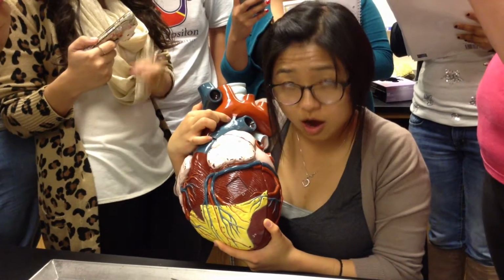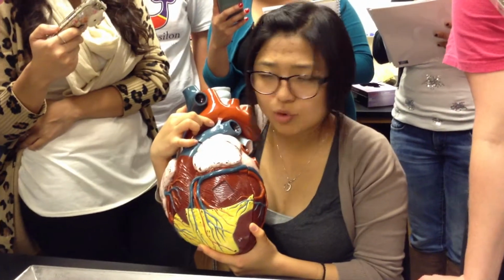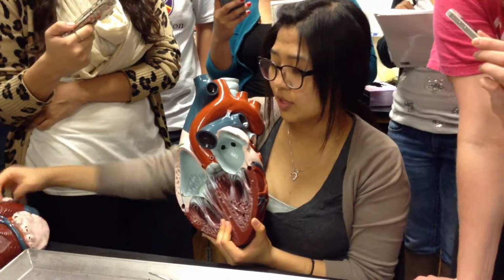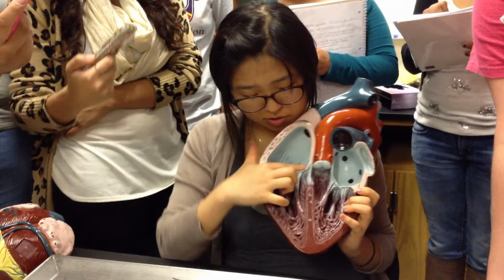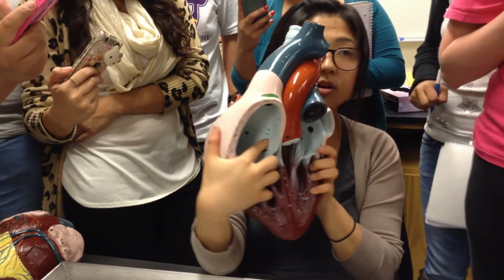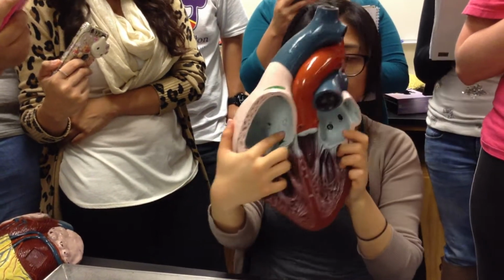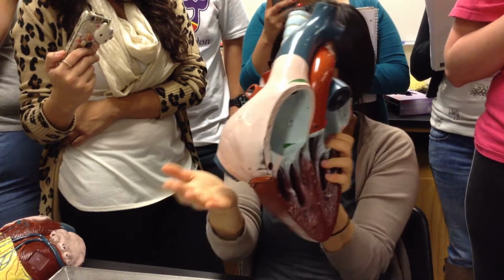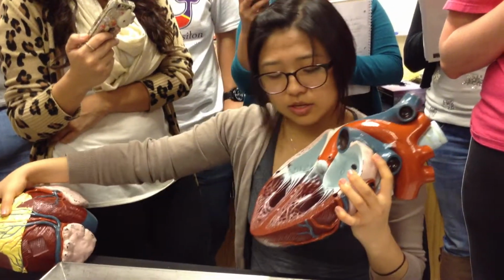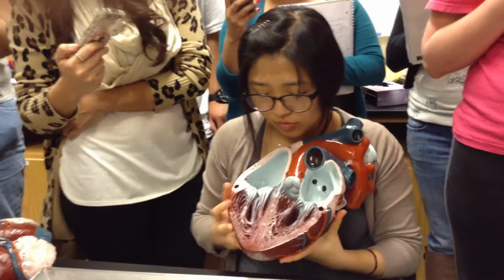Do you guys remember the other embryological structure that was important? Fossa ovalis. And where is that located? Inside the right atrium, right? So if you go into the right atrium, you recall this structure? That's the fossa ovalis, which used to be the foramen ovale. You see it? It used to be the foramen ovale. Cool. I think that's all for the embryologically important structures.